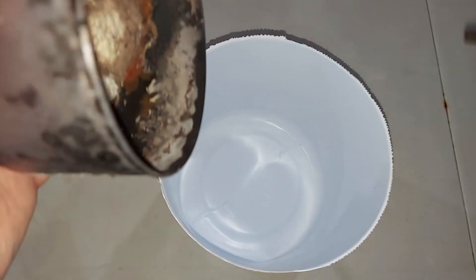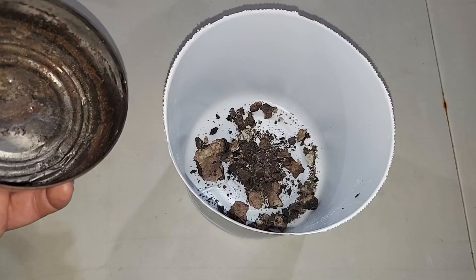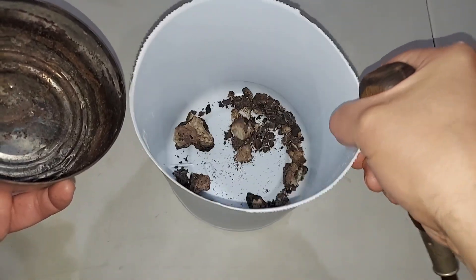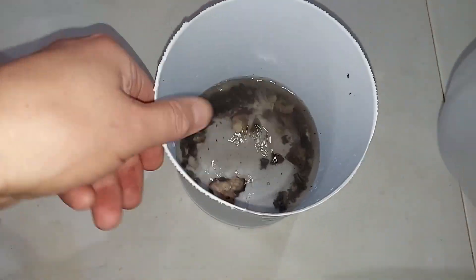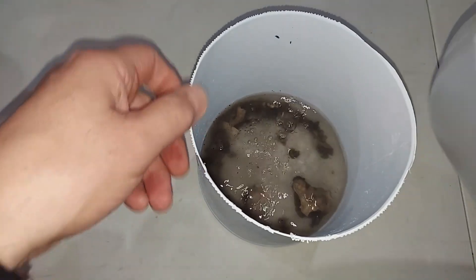To dissolve it, we've got to first chip it out — by gosh, that's really hard. It's all in here and I'm going to fill this with just enough distilled water to cover all of it. This will start to dissolve the potassium carbonate, but if it doesn't dissolve just by sitting, I'll transfer it to a container suitable for heating rather than this plastic one.